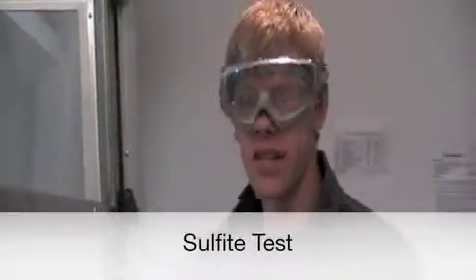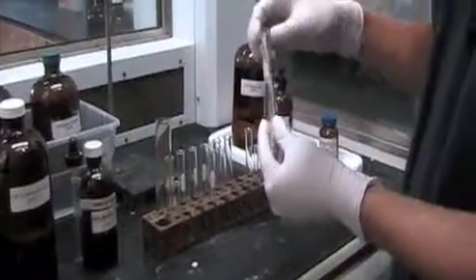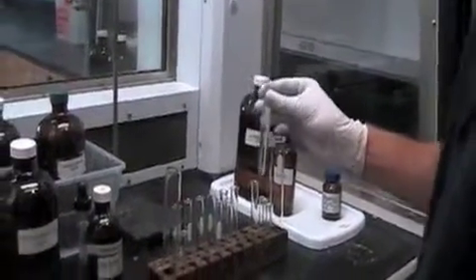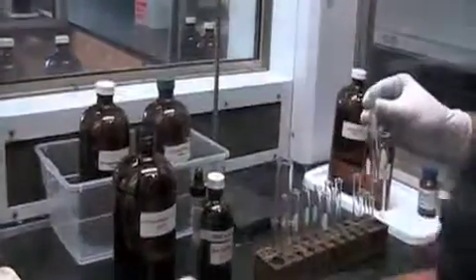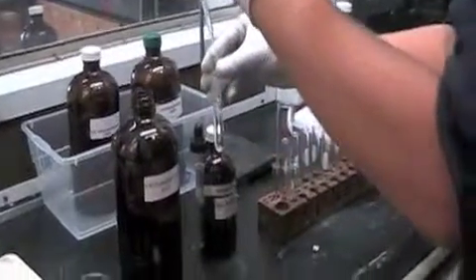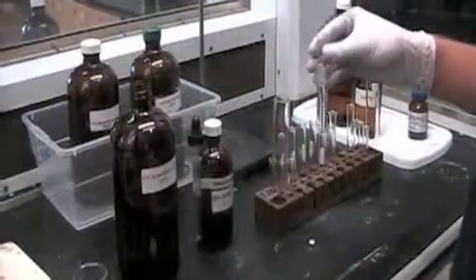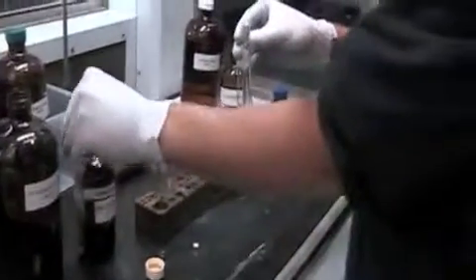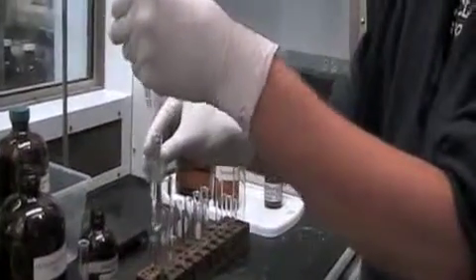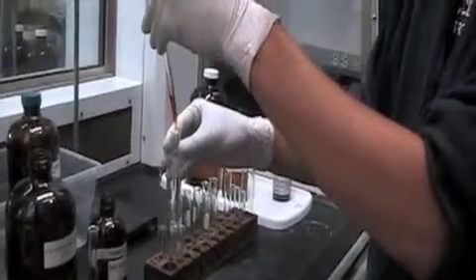Now for the sulfite test, you can take your test tube from the sulfate test — you should not have gotten a precipitate if sulfite is present. You are going to re-acidify your test tube with more hydrochloric acid, and then you're going to add bromine water. If sulfite is present, you should be able to see another precipitate form.